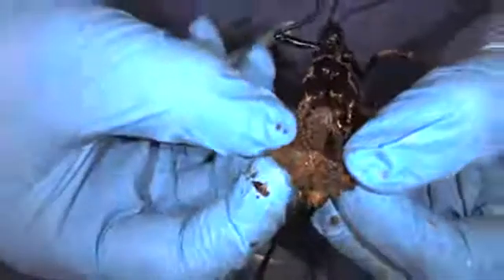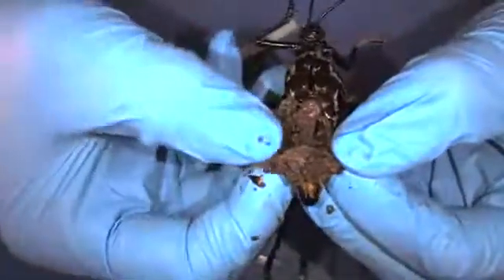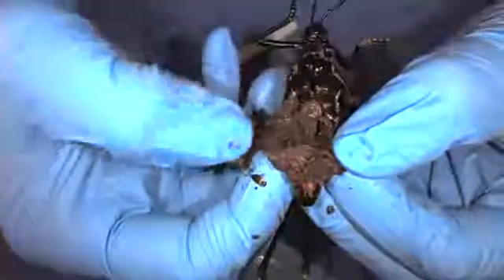Now that we've cut through that and opened it up, we're going to be able to actually see the spiracles. It's a little muddy inside, but if you see these kind of strings connecting to the side of the body, those are the trachea — the tubes connecting to the openings on the outside of the body. That's how they're getting the gas exchange and oxygen they need. They breathe out the sides of their body.